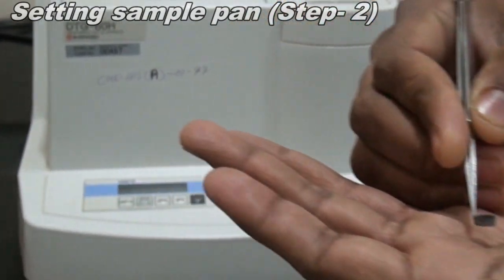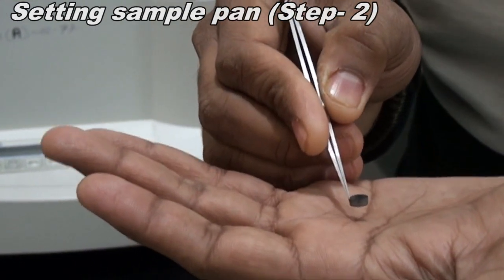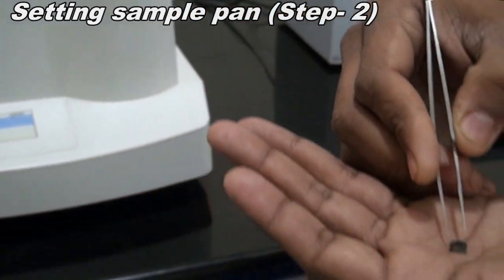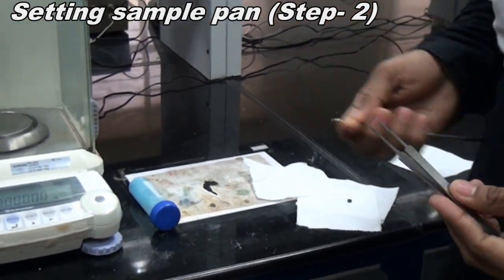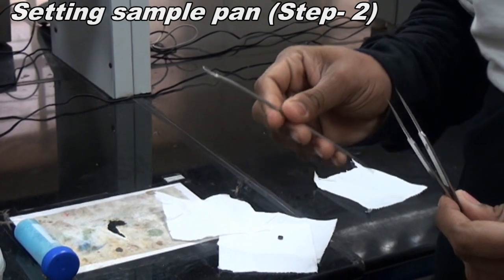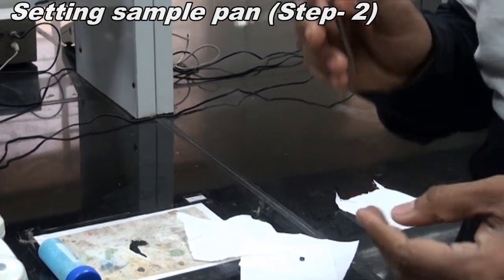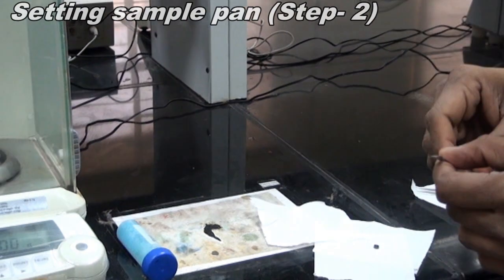There is a simple balance weighing machine, where you have to measure the sample, whichever sample you want to keep inside the sample pan. So now I'm taking it to the weighing balance. Here are the two things you are going to use for sampling. One is a spatula for taking sample from your sample bottle and keeping it in the sample pan, and the other is forceps to hold your sample pan. We need to check whether both are clean or not.